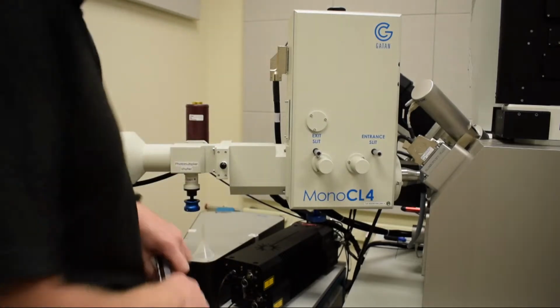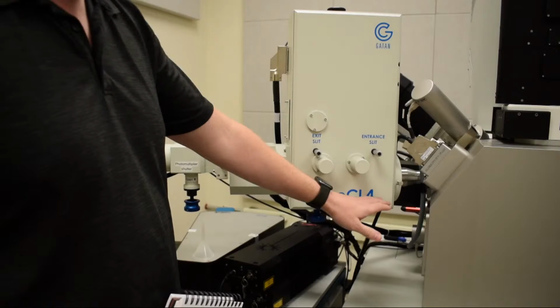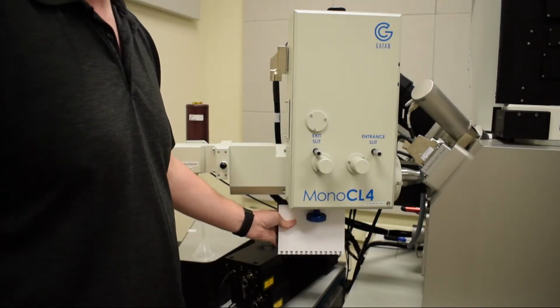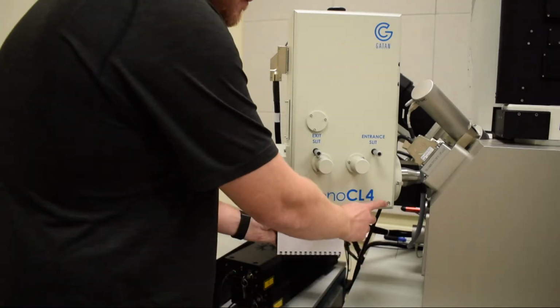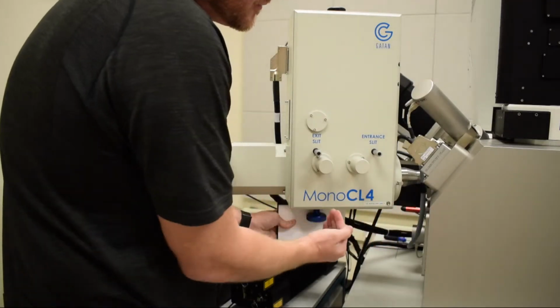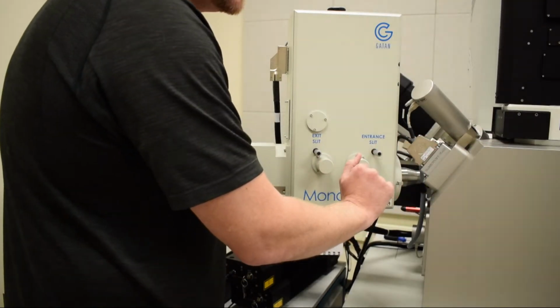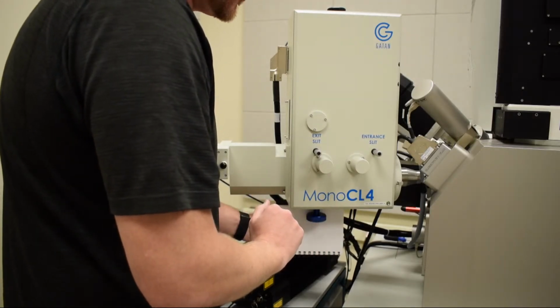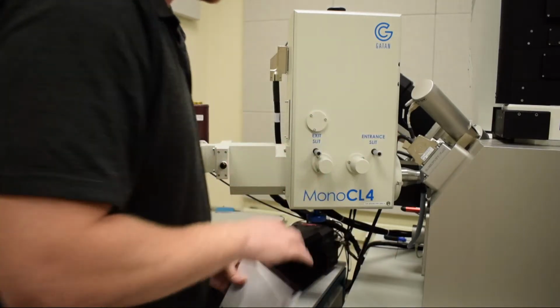And then finally, and most importantly, one of the most fragile parts of the system is the mirror. So here's the mirror retraction knob. It's kind of hard to see because it's a dark knob with a black background. So now hopefully you can see it better. There's a green LED here that is green when the mirror is fully retracted. Green means safe, that we can do regular microscopy. But now what we're going to do is insert the mirror and bring the sample up to the optimal position.